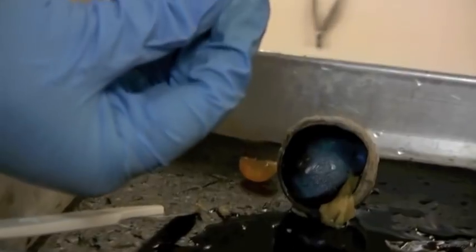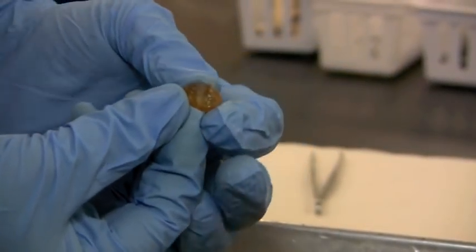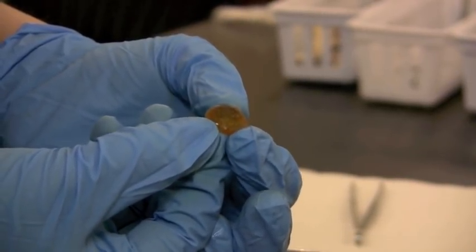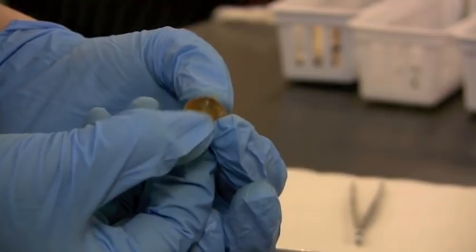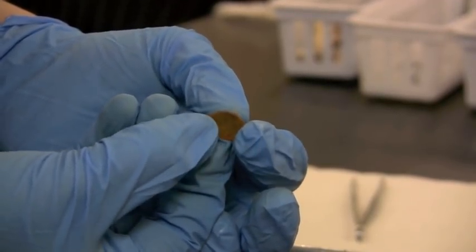So if we look at this interior portion, there's a little bit of clearing toward the center, but it's all these little crystalline proteins and that's pretty much what the lens is made of. It's very hard right now though, because those proteins have changed after death.